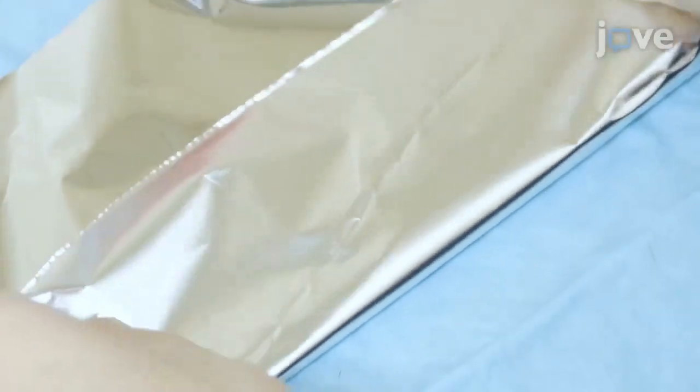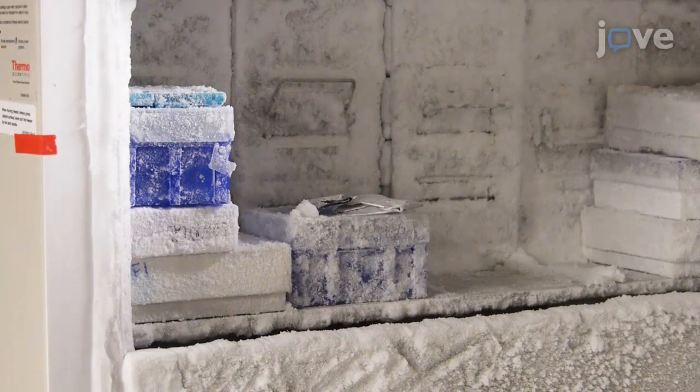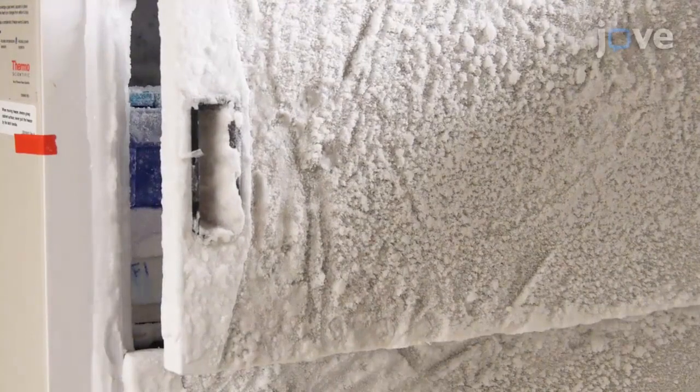For storage, transfer the cryomold into a negative 80 degrees Celsius freezer. Samples can be maintained in the freezer for approximately three months without significant loss of enzymatic activity.